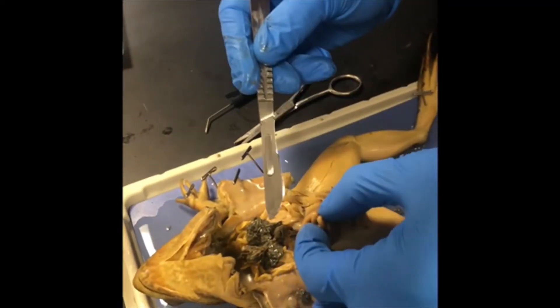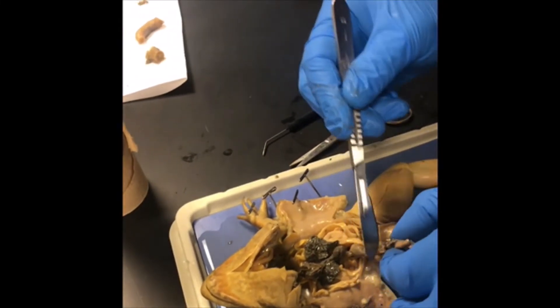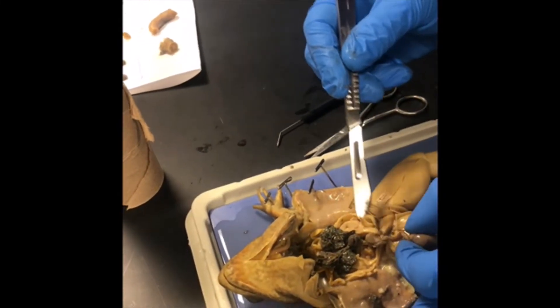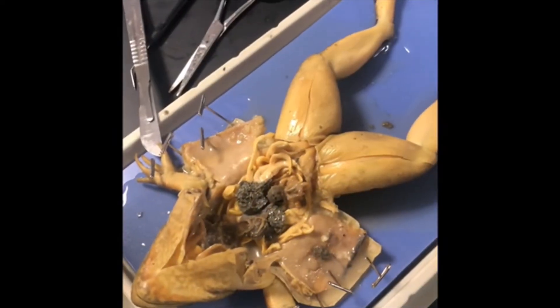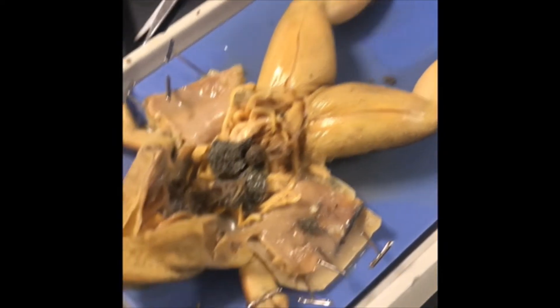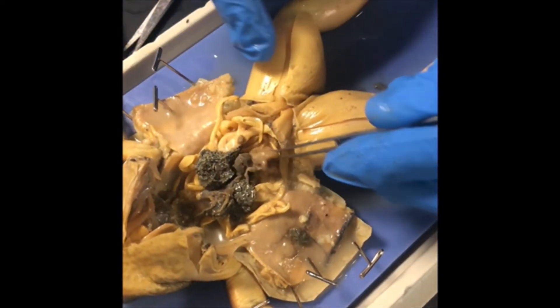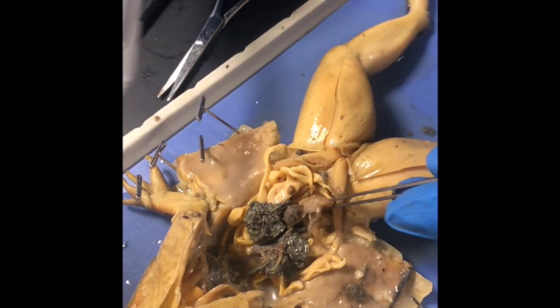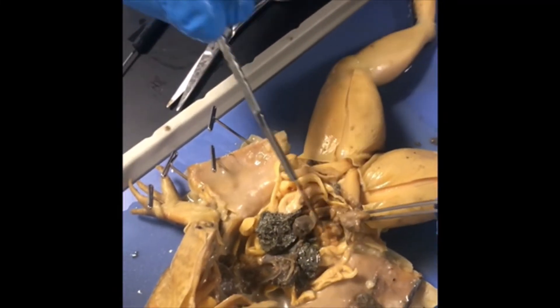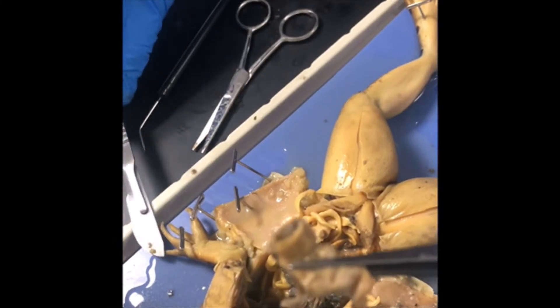I'm cutting into them a little bit. Here are the small intestines. Next, you're going to remove the large intestine and put it on your placemat. The large intestine is obviously hooked up to the small intestine. I'll use forceps to pull it out a little bit because it attaches to the cloaca, then use the scalpel to remove surrounding organs. There is a chunk of the large intestine.